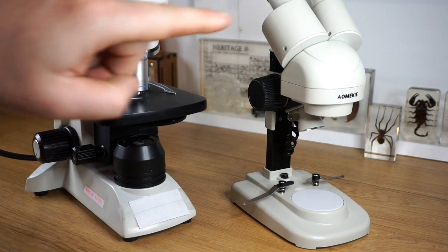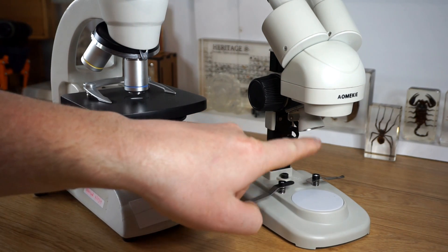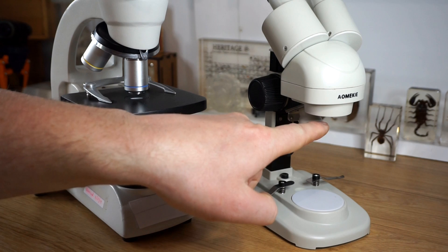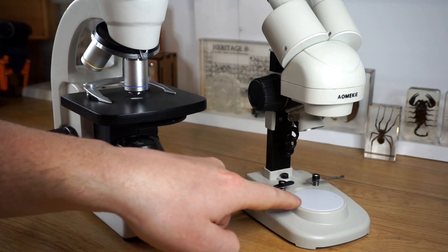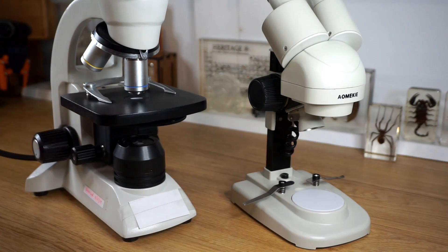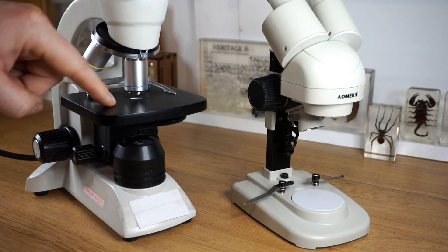Whereas over here on the stereomicroscope, you can see that there's quite a large gap between the stage and the lens. This allows you to look at much larger items with the stereomicroscope compared to the compound microscope.